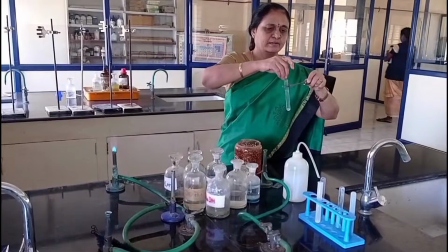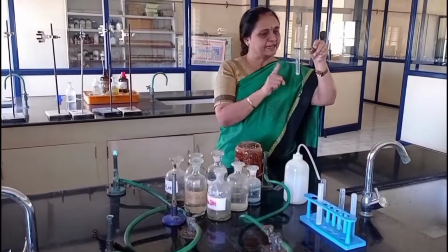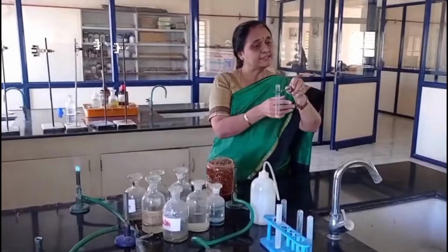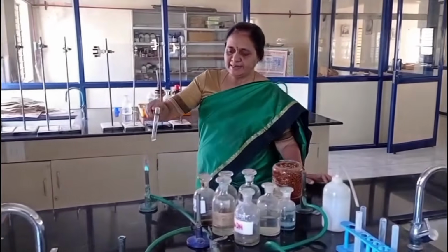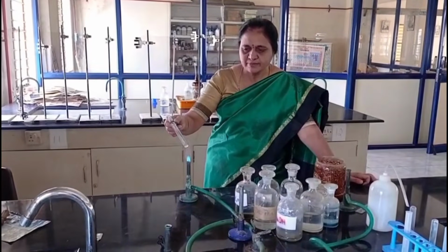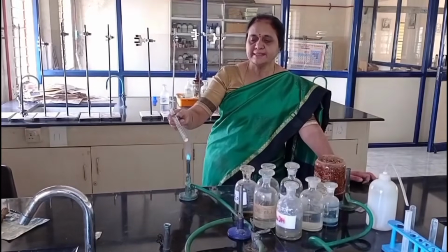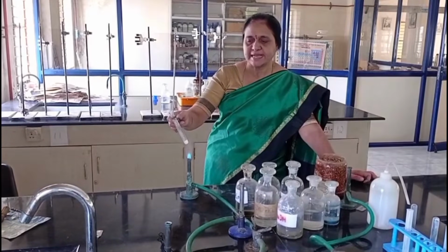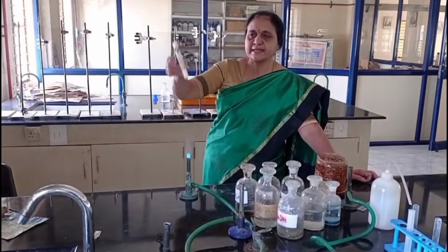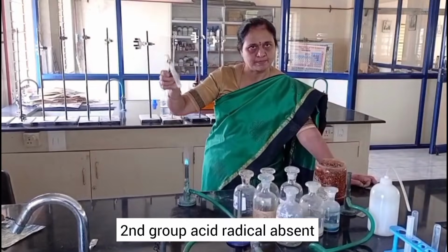First I take salt and concentrated sulfuric acid in a dry test tube. In cold condition I am not getting any characteristic gas. So I am heating the test tube by adding copper turnings. Even on heating also I am not getting any characteristic gas like orange color or white color. So second group acid radical absent.